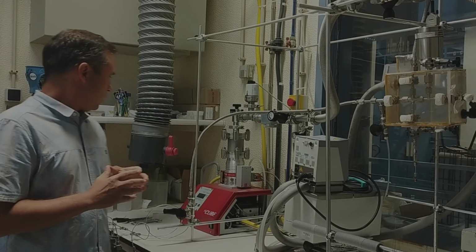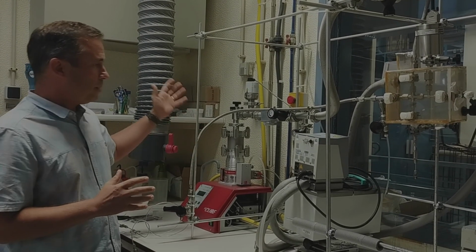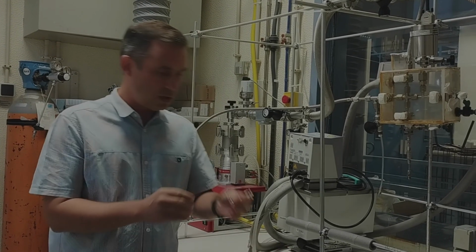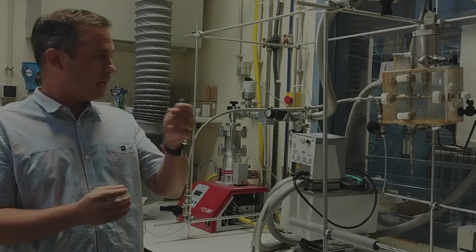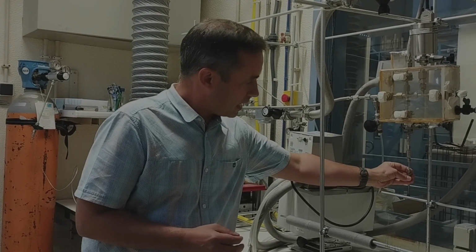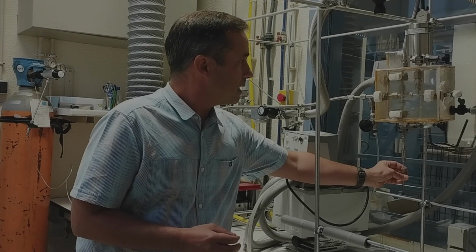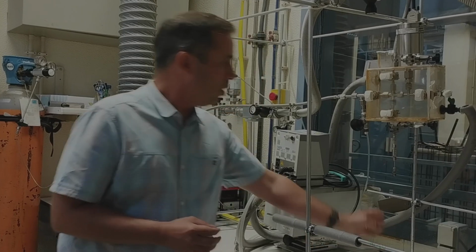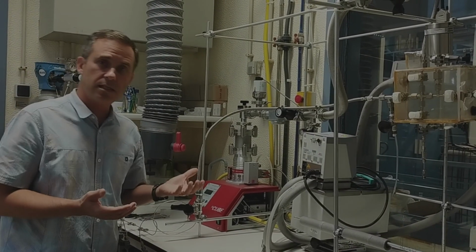So we can, for instance, using high vacuum pumps, make vacuum on the materials that we introduce inside these small cells. We can connect the material to this line, and the purpose in here is to dose small amounts of different gases.